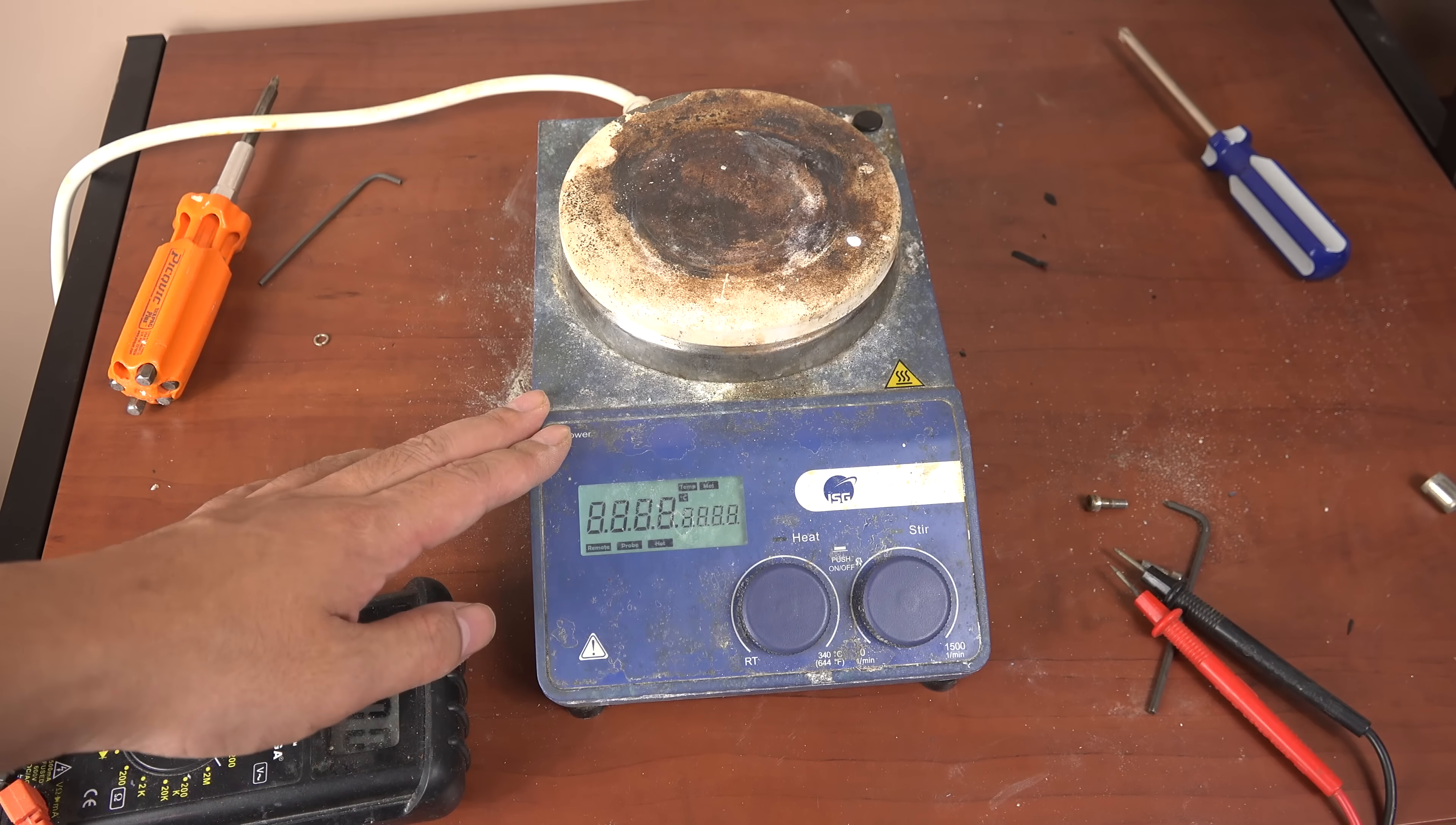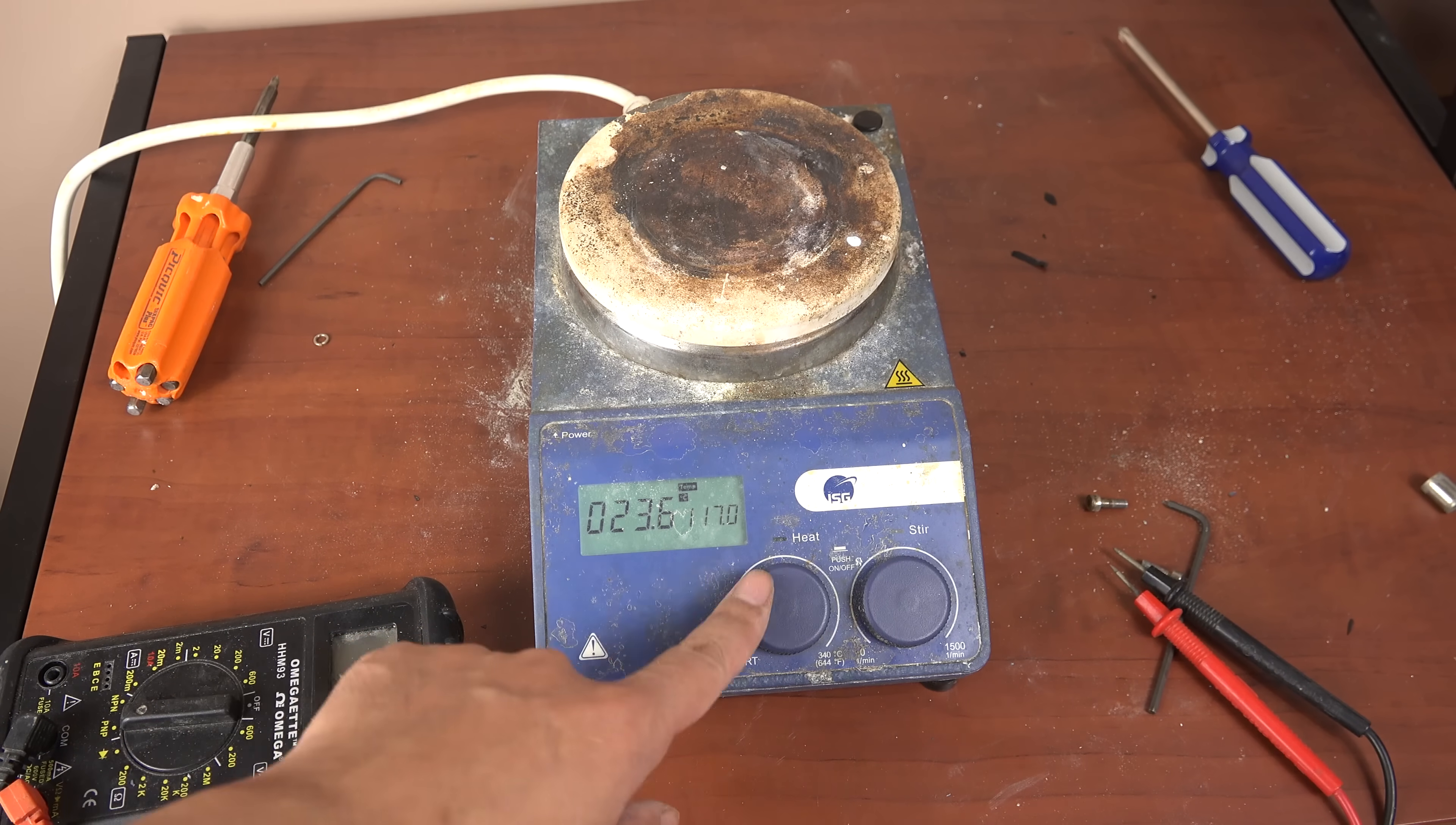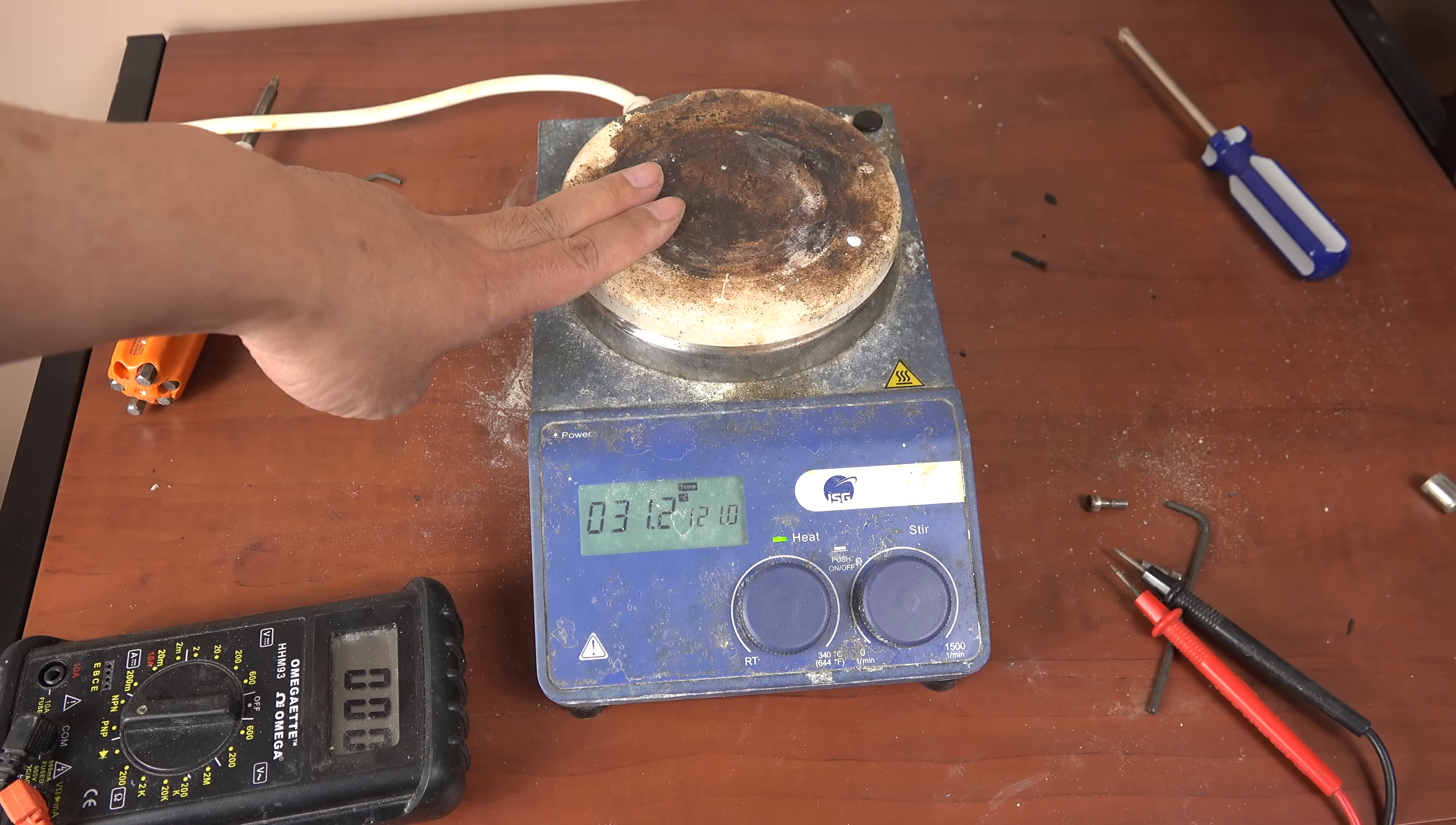And now for the major test. And we're getting an accurate reading for room temperature. Now let me turn on the heating element. And it seems to be working, it's definitely heating up, I can feel it.